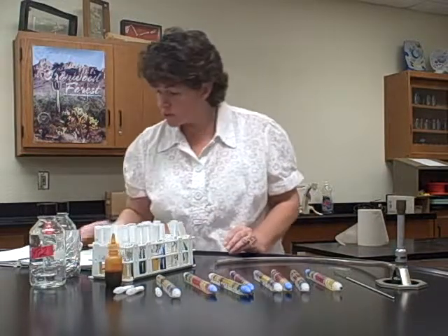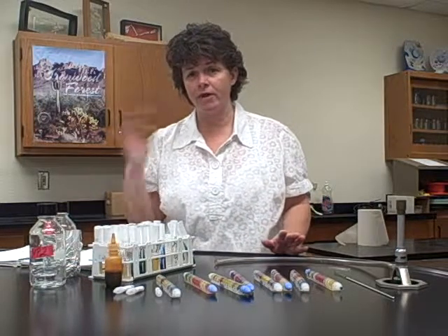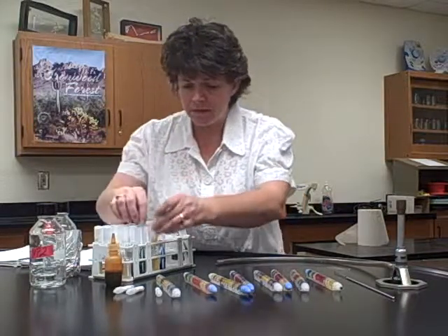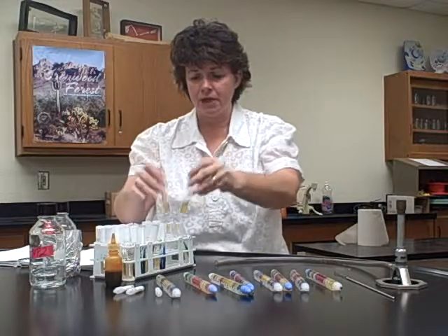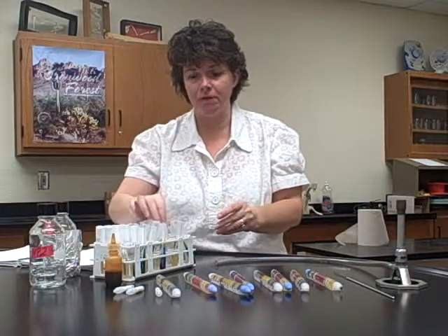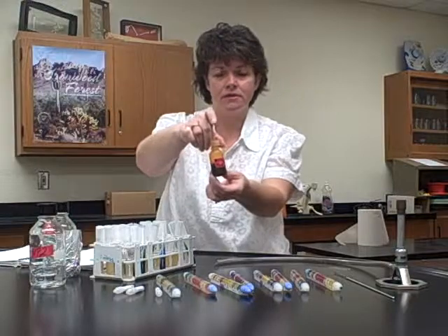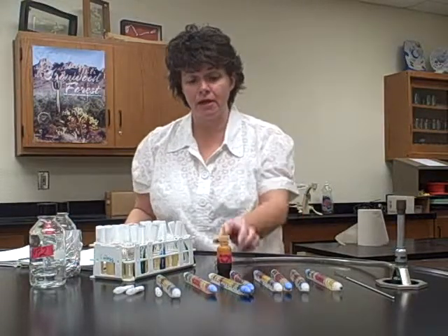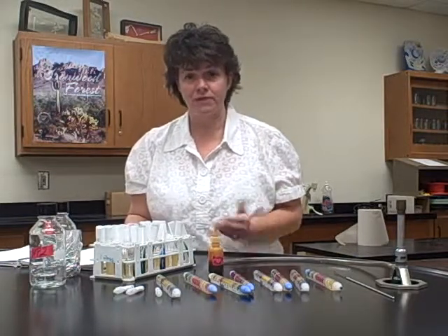Okay, the next one is the methyl red and the VP test. Recall way back when we did fermentation of carbs, you would have the 2 MRVP tubes. They were the brown colored media, and remember, 1 tube is for methyl red, the other tube is for the VP, okay? For the methyl red, remember you added the methyl red here, and if you go back to the fermentation of carbs, it'll tell you how many drops to add, okay? And once again, you're looking for a red result if it stays red.